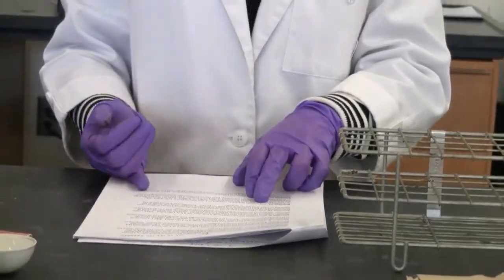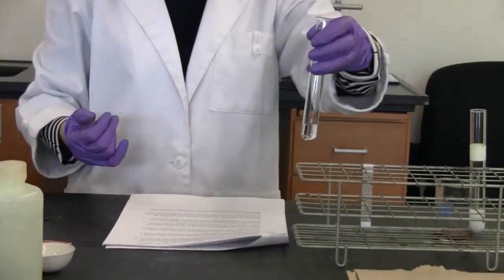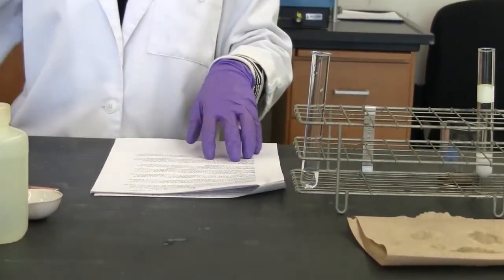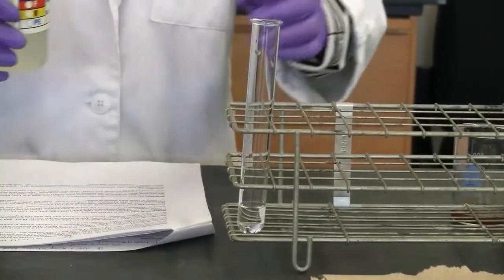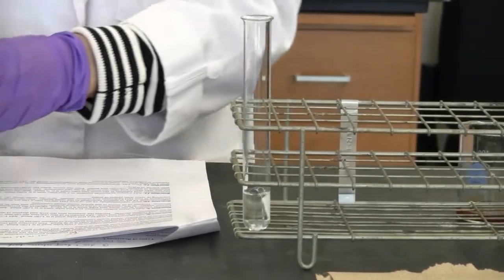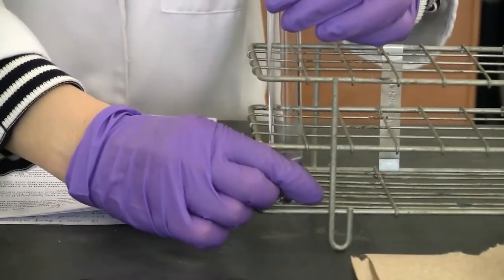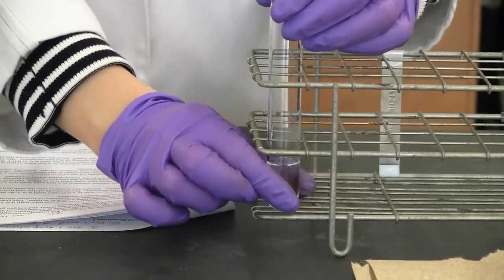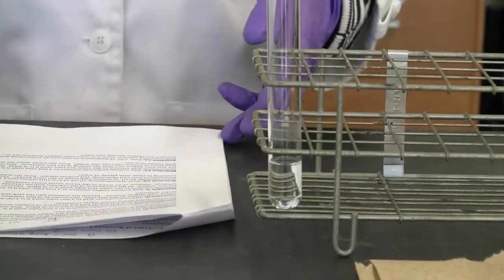Reaction 11, we need to add a sodium hydroxide solution to a test tube until it's 1/8 filled. So it's already in the test tube. We need to add hydrochloric acid to the same test tube. And this one we need to feel the temperature change. So I'm going to feel that. I'm going to let you know. But first, let's see if there's any visible change here. Looks like nothing, but let me feel that. Oh, it's really hot here. Okay, so the test tube turned hot. Okay, warmed up. All right, so that's reaction 11.